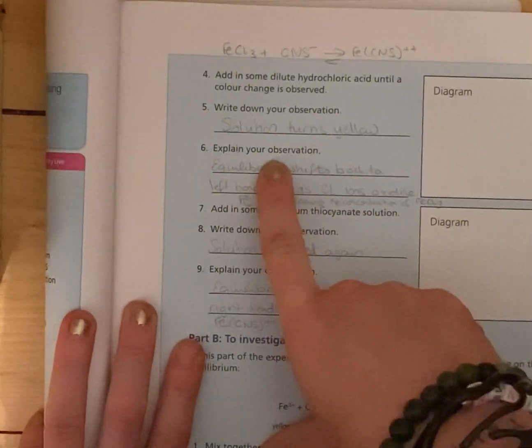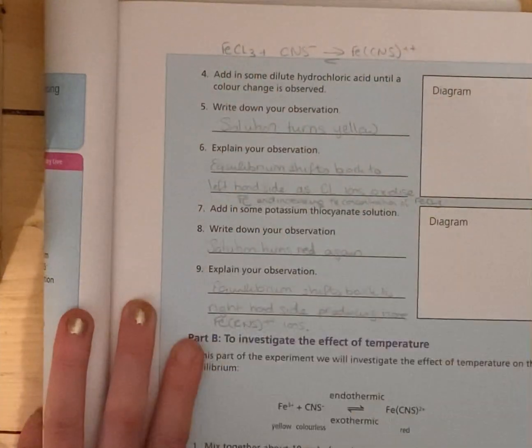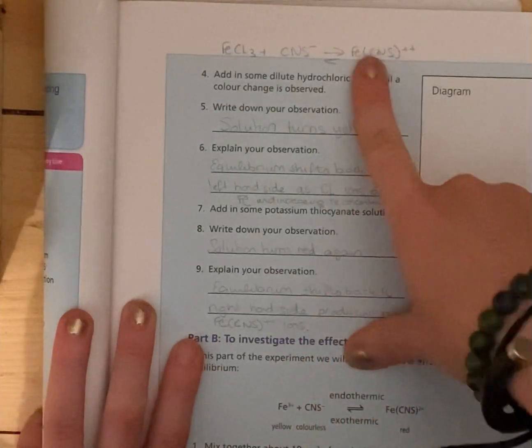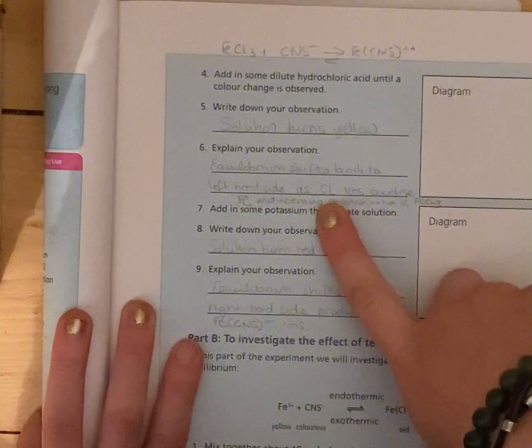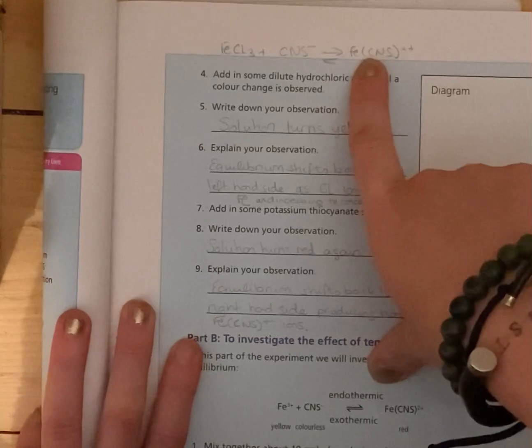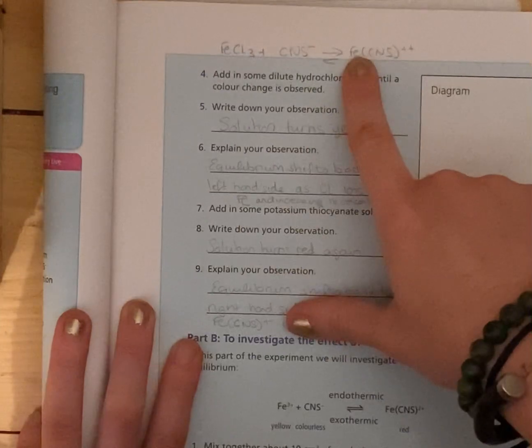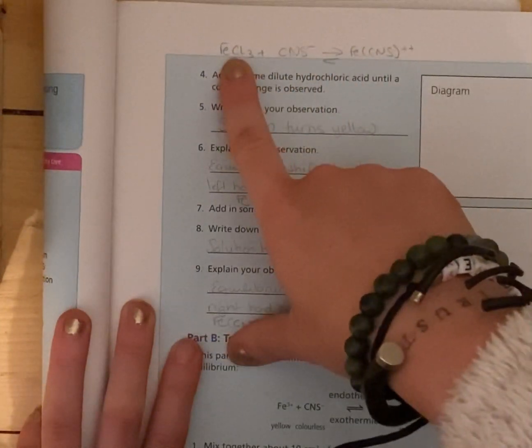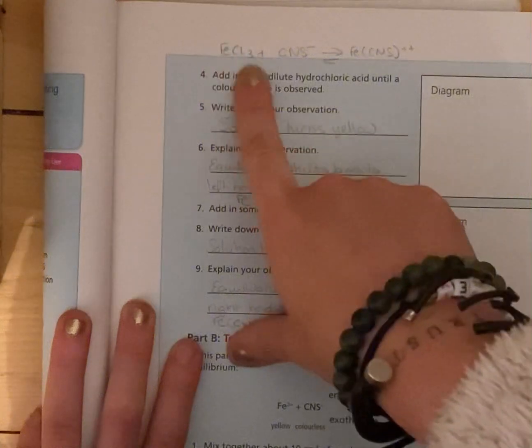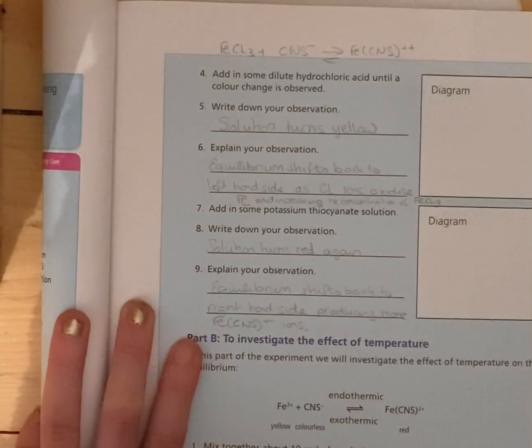So explain that observation: the equilibrium shifts back to the left-hand side where the iron chloride is. As the chlorine ion comes in, as we know, chlorine is a halogen and it's a good oxidizer. So it oxidizes this, breaks up this chemical, and shifts the equilibrium back to here. Because the iron is oxidized, it'll join back up again with the chlorine from the HCl and form more of this substance. So we're going to get a shift towards the left-hand side in this scenario.